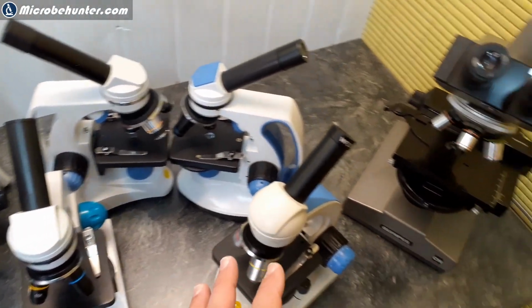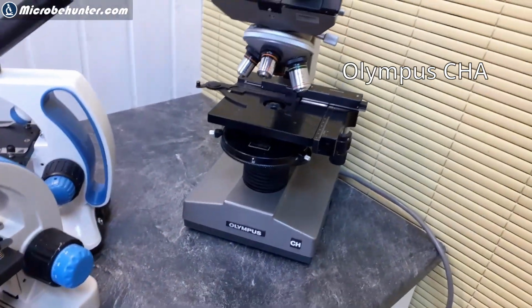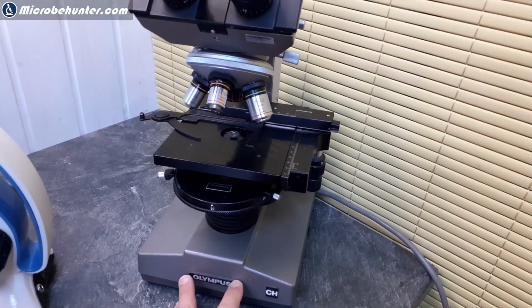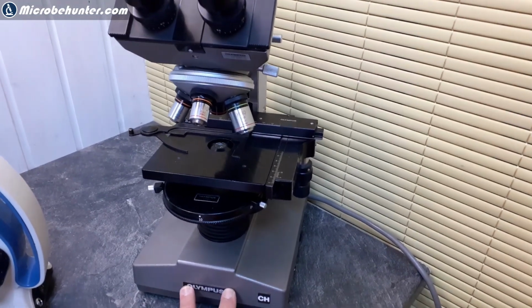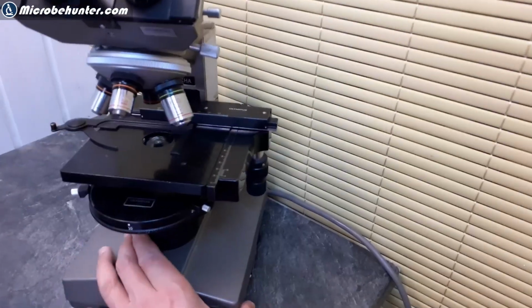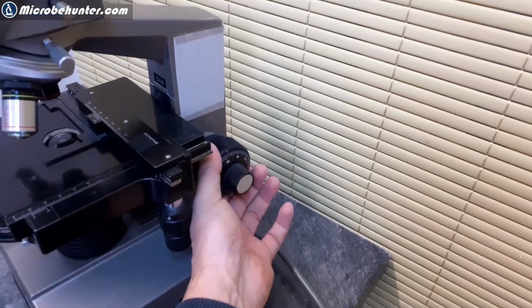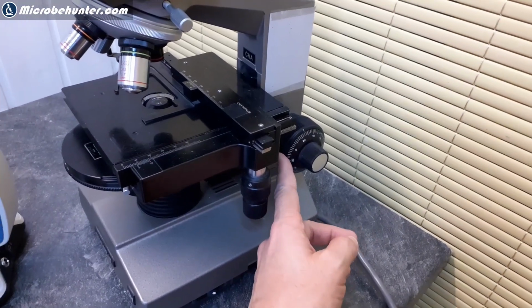But I'm going to go on now to a different one. Look at this here. That's also an Olympus microscope. This one is from the late 1970s, 1980s. It has been in use in education in school for almost 40 years. And I got it for free, because they were discarding it. I'm a teacher in a school, and they were changing microscopes around so all teachers could take one along. It was not functional because the focusing knobs could not be turned anymore, because the lubrication oil solidified.